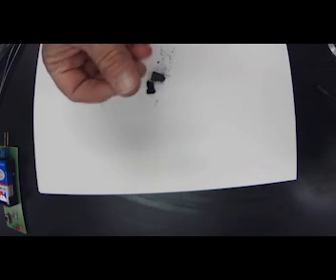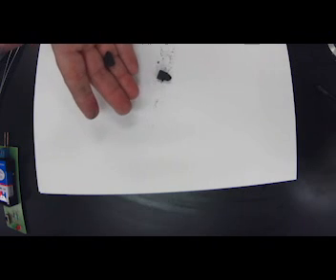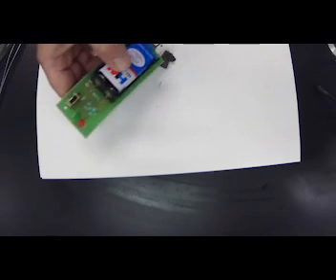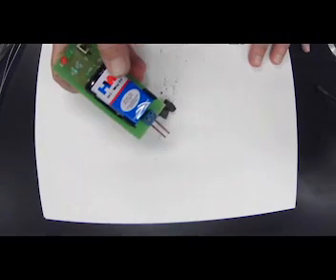Other physical properties, it's very dusty. It's got dust everywhere. It's not very lustrous. It's kind of a dull black color. Okay. And then let's see about conductivity. Does it conduct electricity? See if I can get my conductivity meter in there so you guys can see it. Got to move it the right way, Miss V.